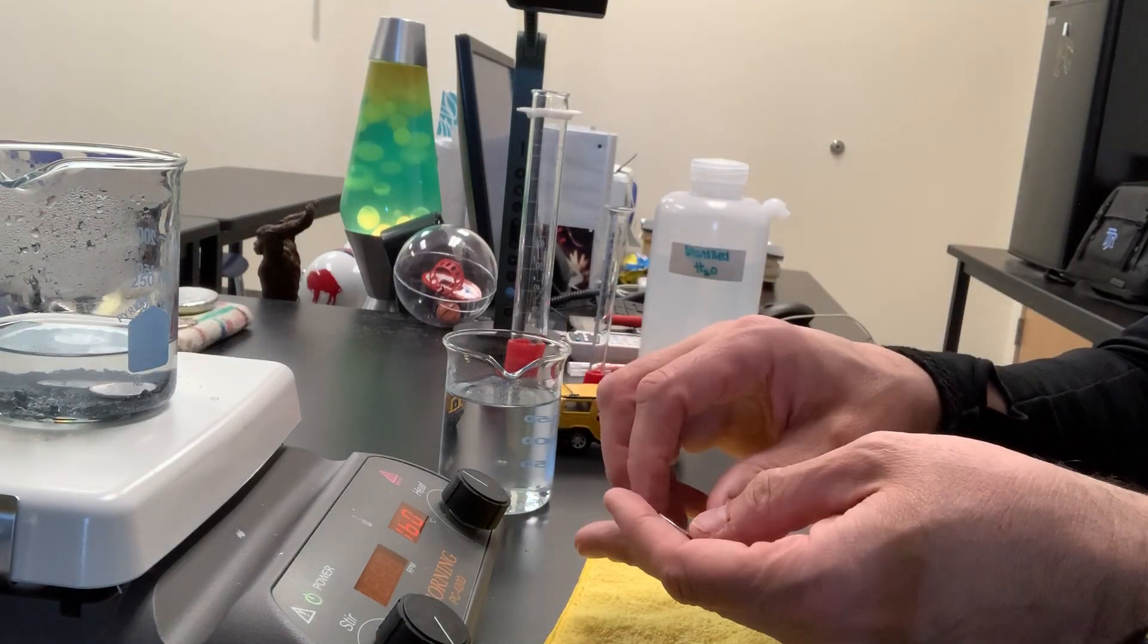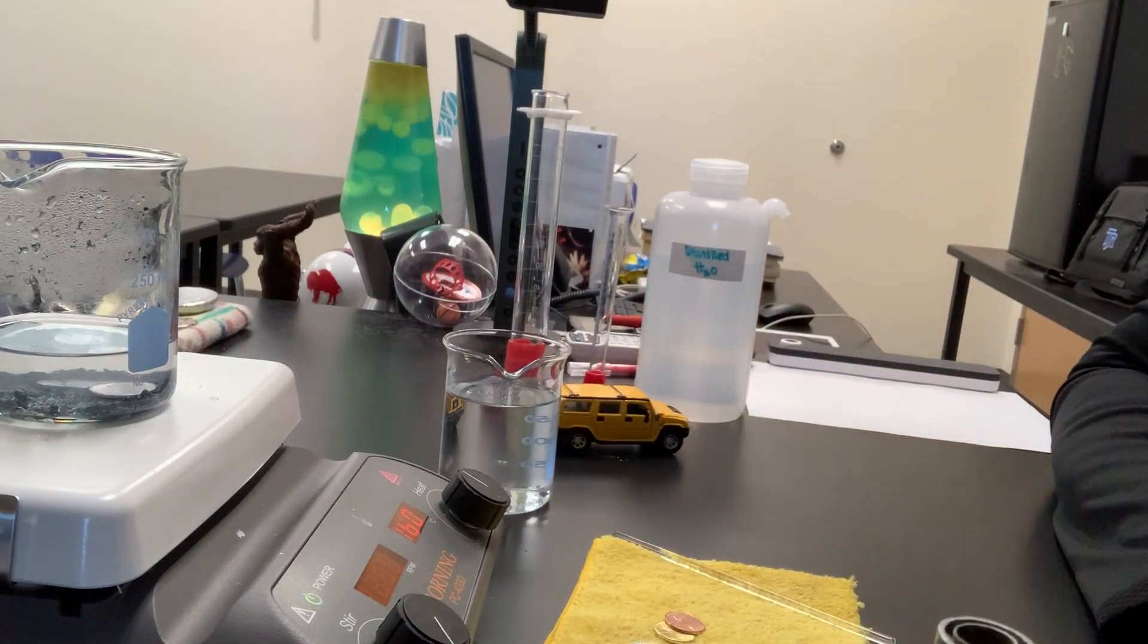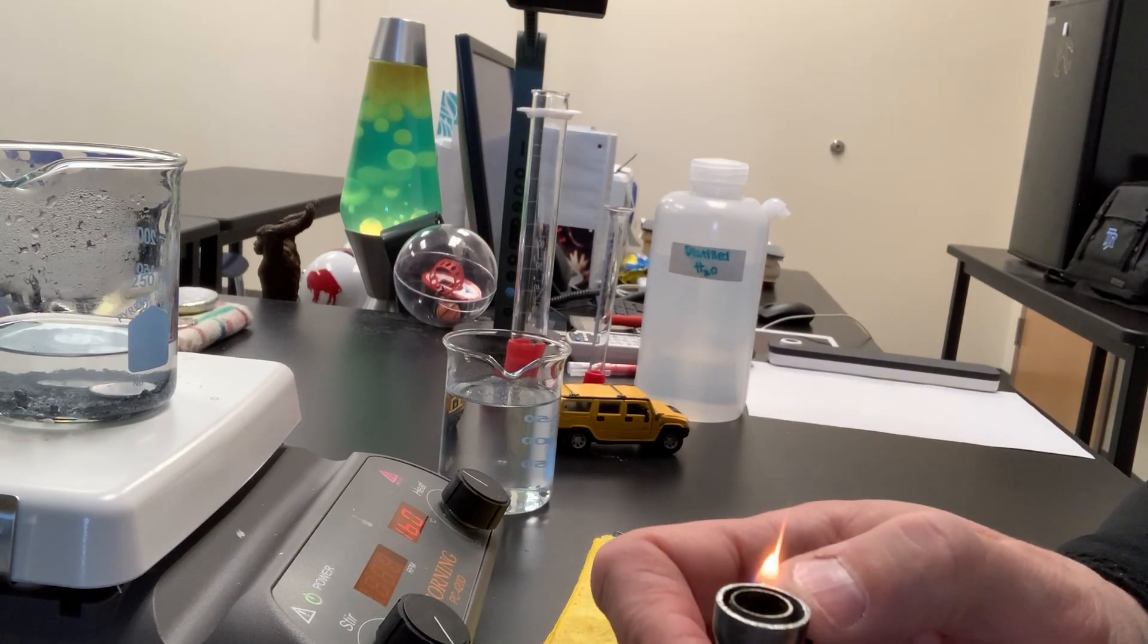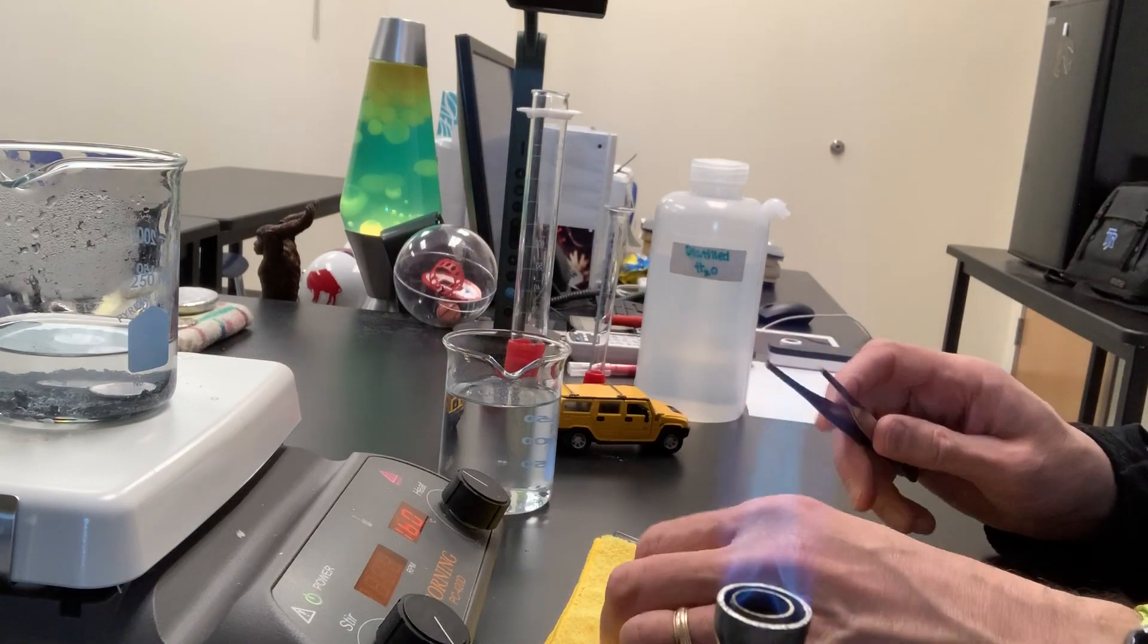Let's take the other one that's zinc-coated and do the same thing. Let's mix the zinc with the copper a second time.